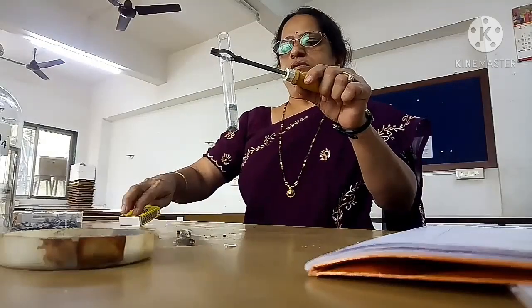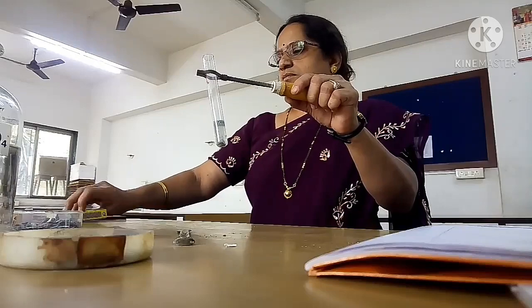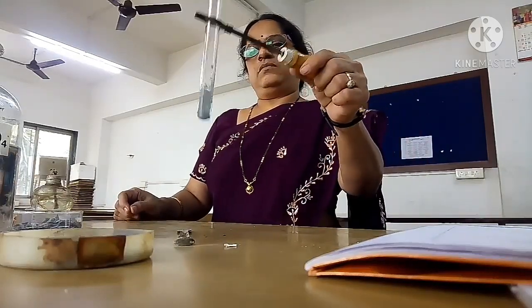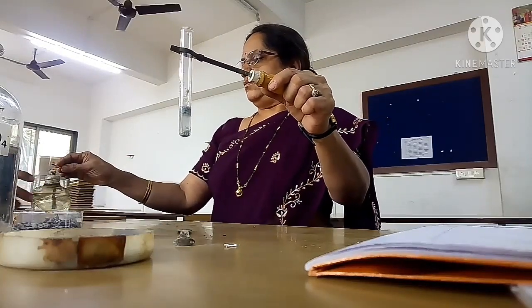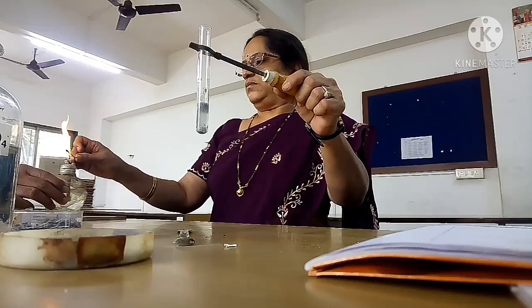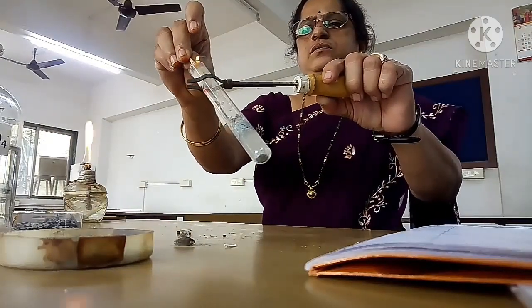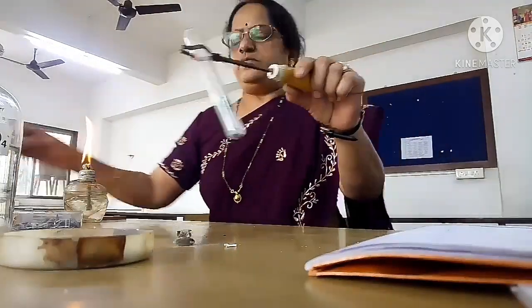Now you can see it is not getting extinguished, but it burns.